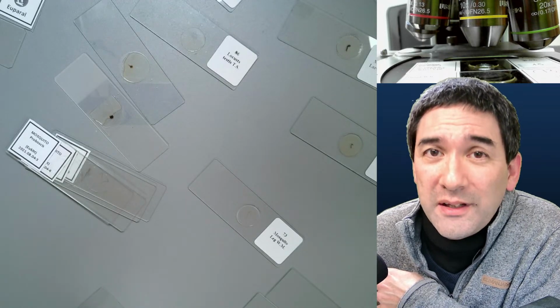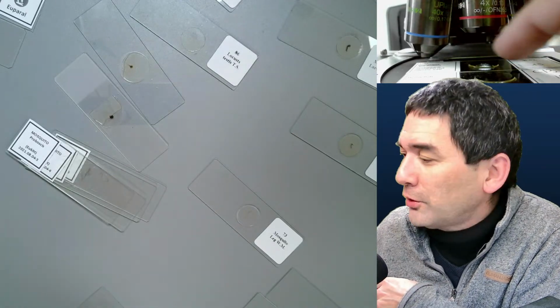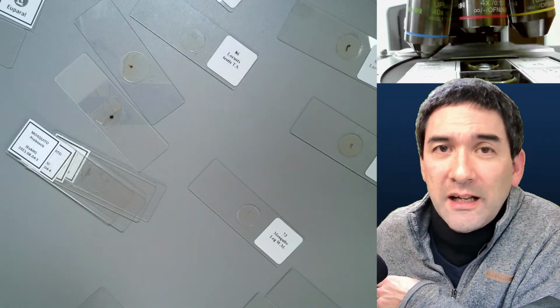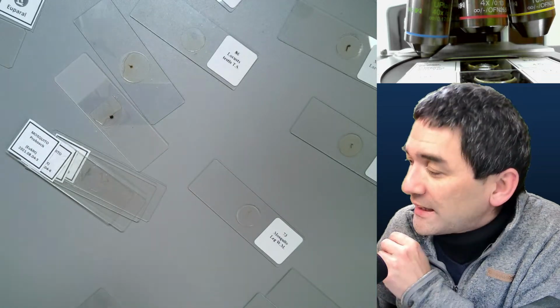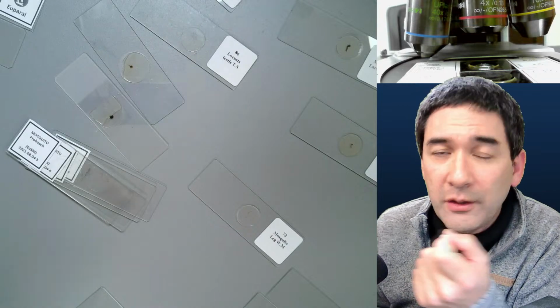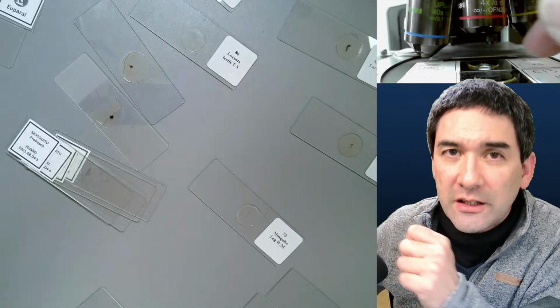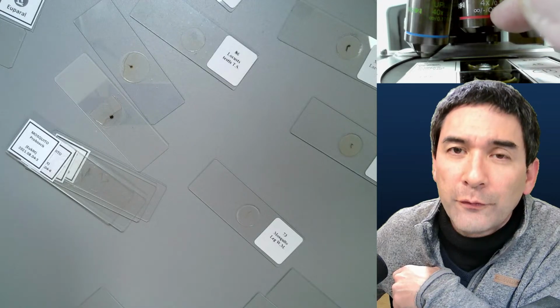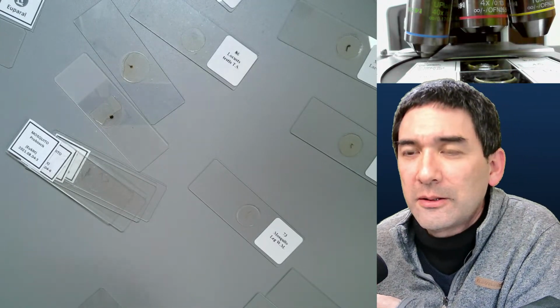But what you can do in this case is put the microscope on low power. You put the insect on a blank slide, and then you use a strong flashlight to observe it from the top. So that is also possible. If you've got a whole fly or any object, you put it directly on the slide here, take a strong flashlight, and with low power, 4 times, you'll get a surprisingly good result.